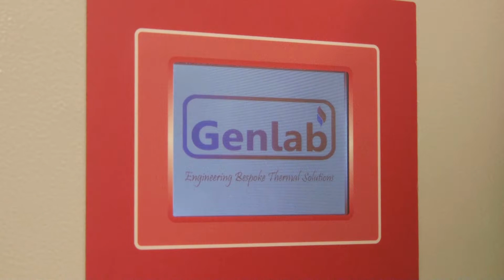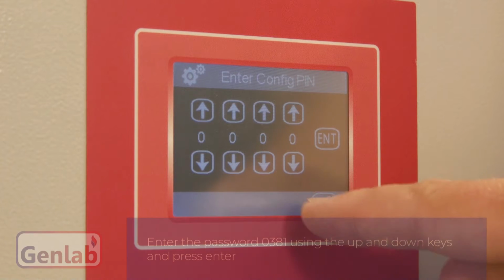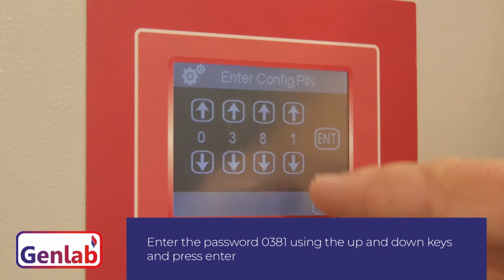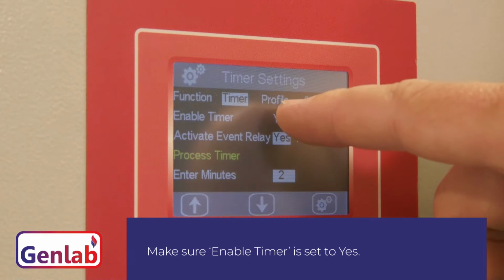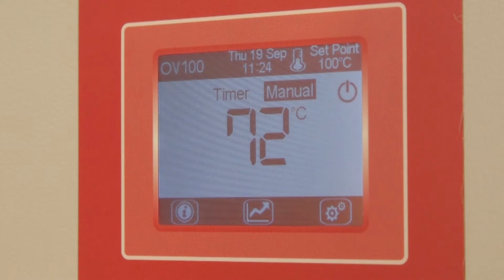To change timer modes and adjust timer settings, enter the password 0381 using the up and down keys and press enter. Press the timer icon. Make sure Enable Timer is set to yes. If it is set to no, you will not get a toggle switch on the home screen as shown here.